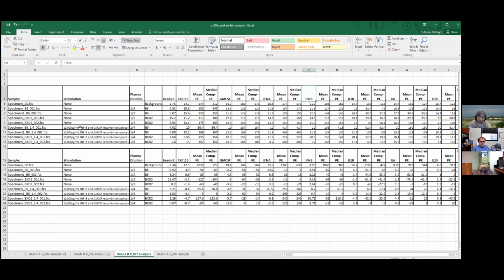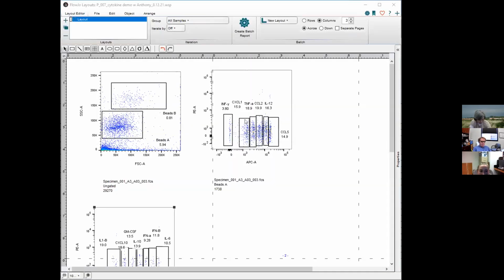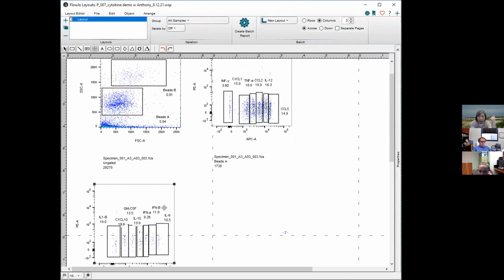I think I understand it now. I've kind of got it up to date as far as why things might not work and the low number of beads. Yeah, I'll show you. I looked at everything on FlowJo too, and I'll show you what it looked like last time we did it. Do you see how few beads there are? Like I could barely get any separation. Oh, you mean this is from last time, not this time? No, this is from this time. So look at this, right?